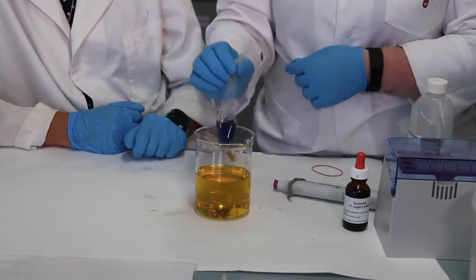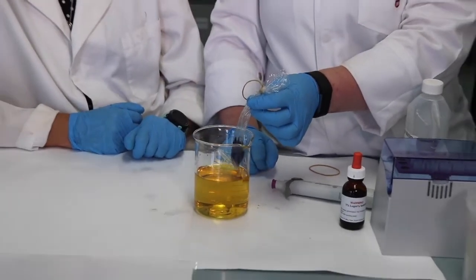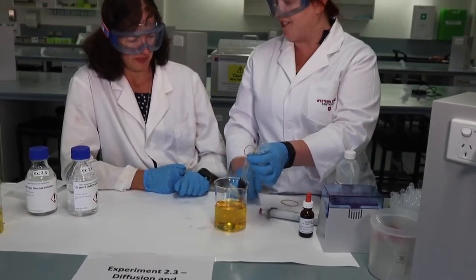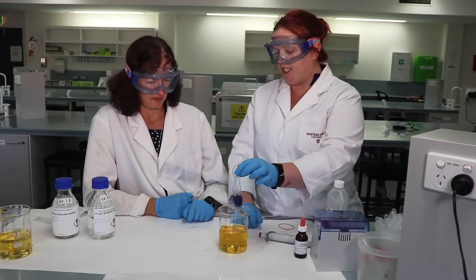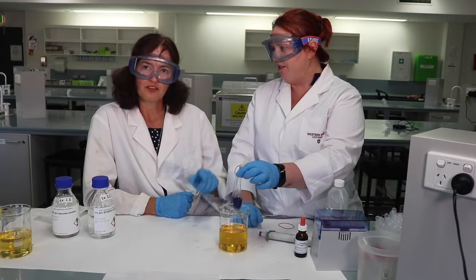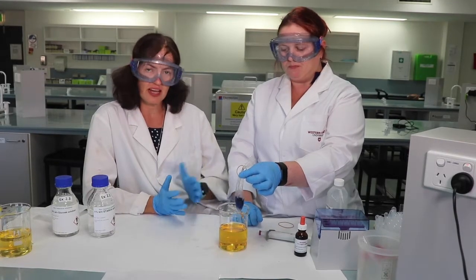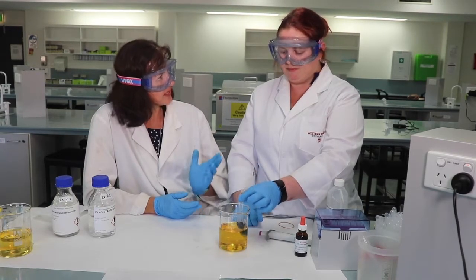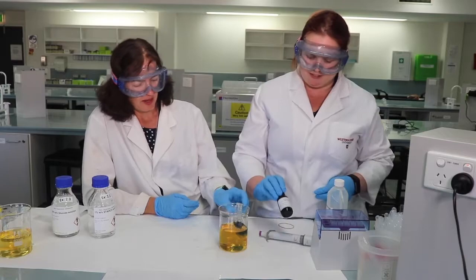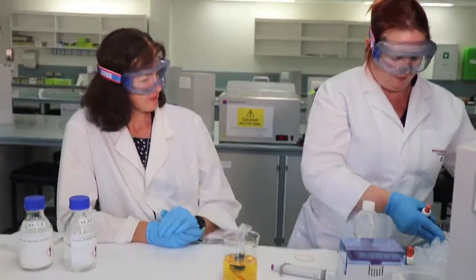So the next part of this experiment is we want to actually be testing for reducing sugars, so glucose in this case. So what do you think, Susan? Should we find glucose in this bag solution? Well, did we put glucose in the bag originally? Yes. So, of course, glucose is colourless, so we can't see a colour change if glucose has moved, and that's why we need to do the Benedict's test. Yeah. We have the beaker solution, we have the bag solution.